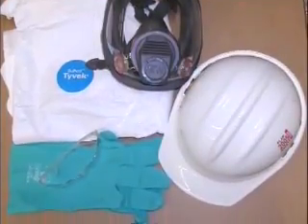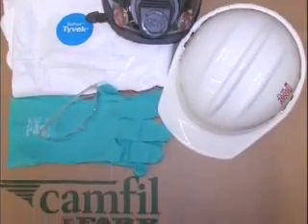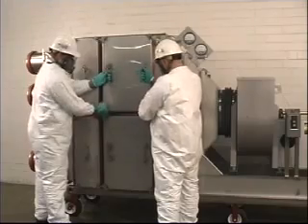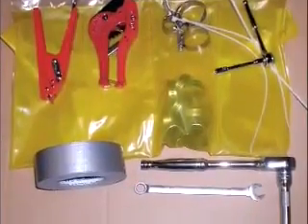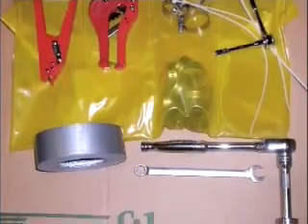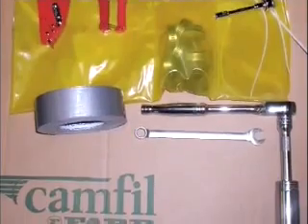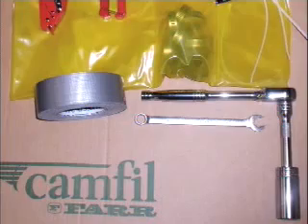To perform the filter replacement on the BSL4 bag-in, bag-out filter housings, maintenance workers should be clothed in Tyvek coveralls, hard hat, safety glasses, gloves, and gas mask if applicable. Use these guidelines along with any amendment or procedures of your company's safety policies. You will need a ratchet with extension and an 11/16" socket. A banding kit, available through BSL4, can assist in the change-out of the filter and will be shown in this demonstration video. The twist and tape method can also be used and will be described in this video also.